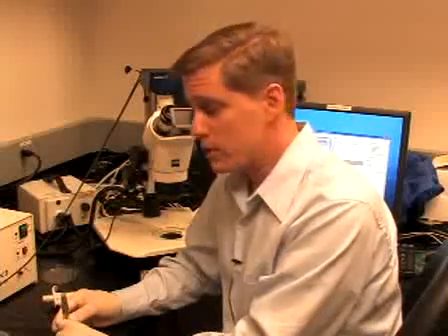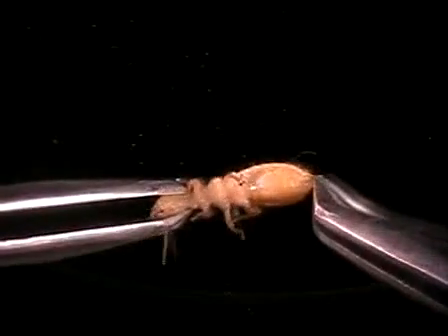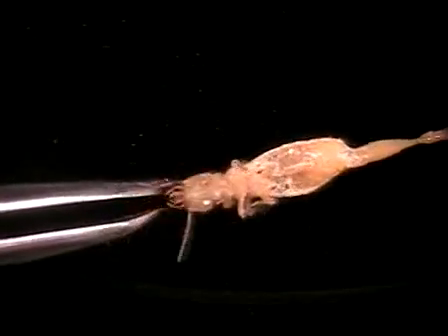Whenever we do a gut extraction, it's always a good idea to check the status of the gut contents. So we do that by dissecting a termite and just making sure that it's representative of things that we've seen in the past. We'll actually do that visually by looking at the cells in this microbial community. Just at the very tip of the abdomen here. And with one pull, you should see the gut tract.